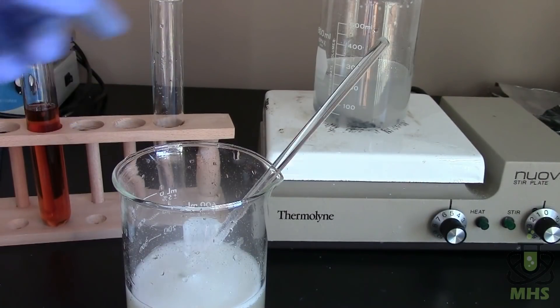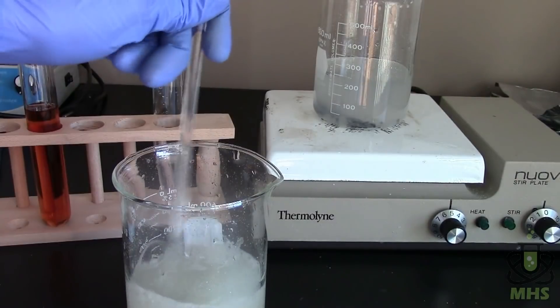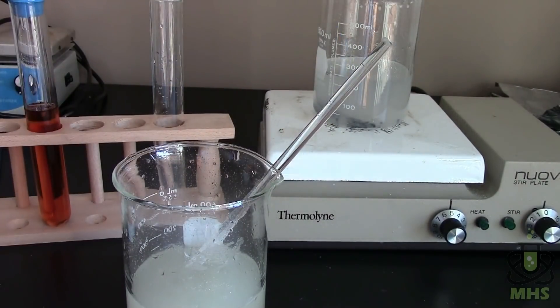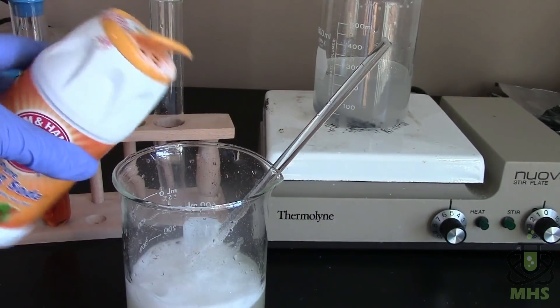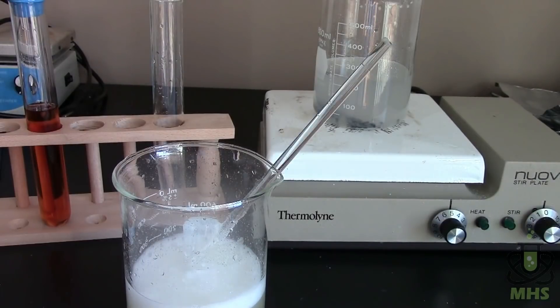So that's what I'm doing back there. And you might notice that the volume is a bit different than what I started with. I combined this reaction with the previous time I tried it and failed.